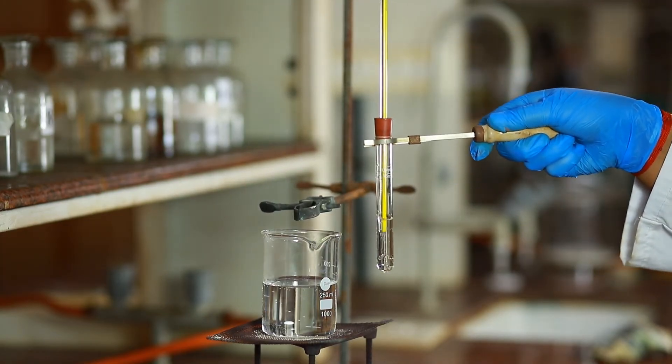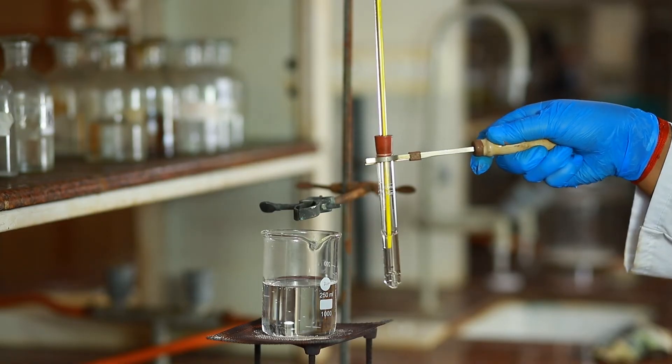Shake the reaction mixture occasionally between 40°C and 60°C.